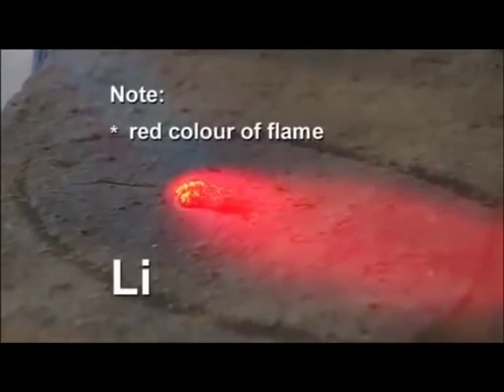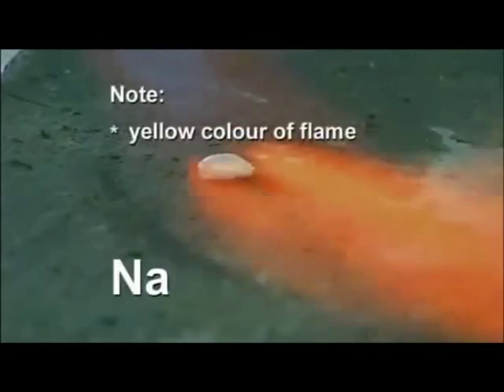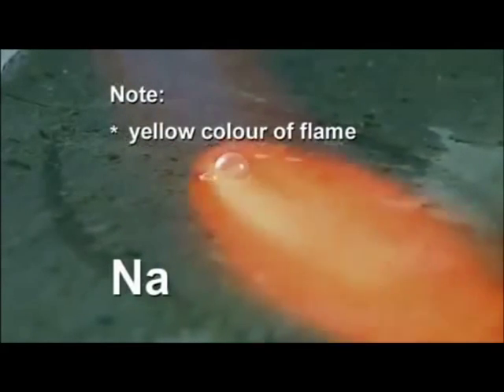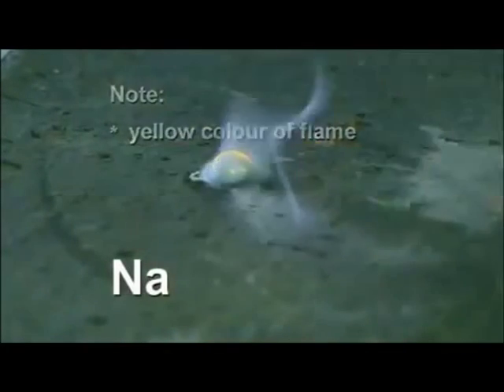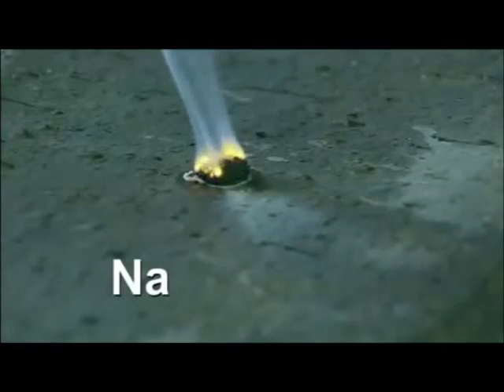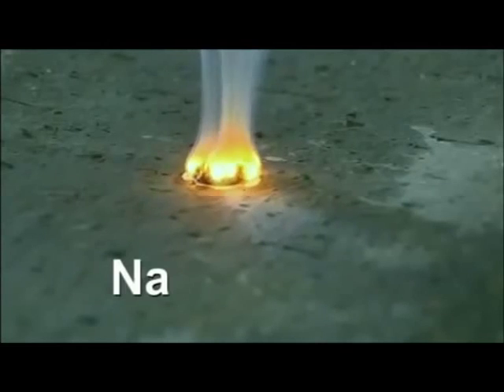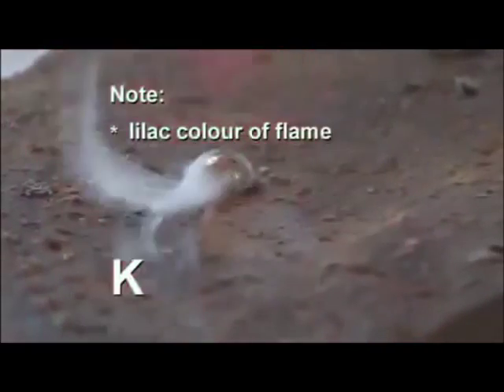Position the metal at the top of the blue cone, which is the hottest part, with a roaring Bunsen flame. You can see it melting and reacting with the air. It very quickly melts. You can just see a purple flame.